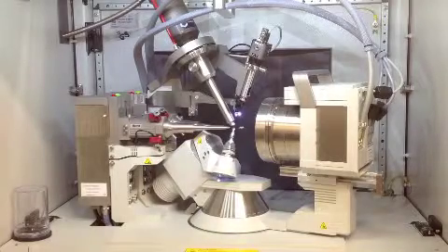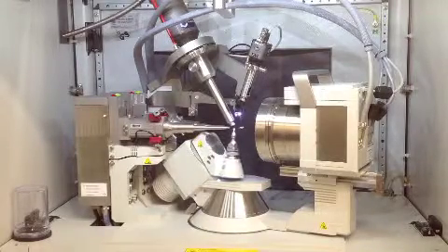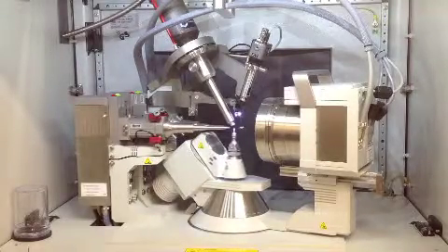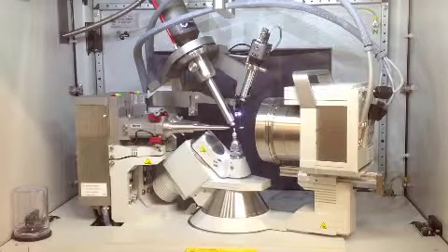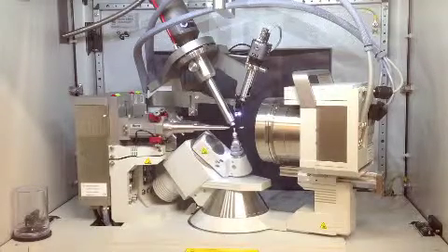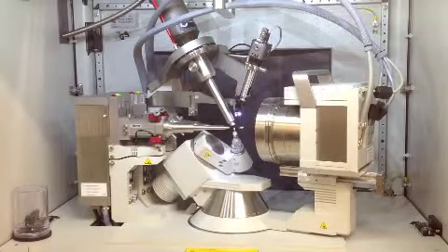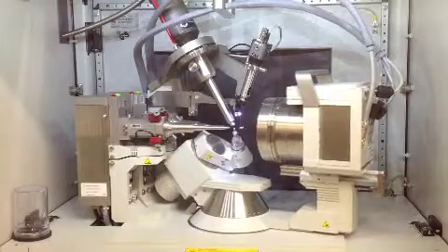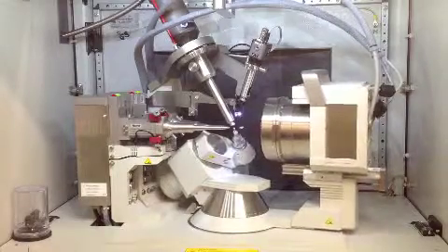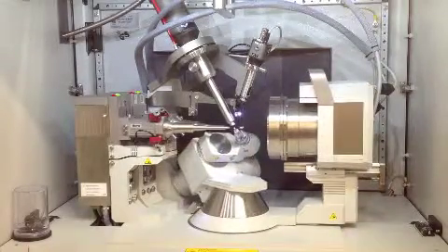The diffractometer measures the diffraction pattern. X-rays are fired at the crystal. When the X-ray hits an atom inside of the crystal, it bounces off or diffracts. The camera records the diffraction and a pattern is produced.